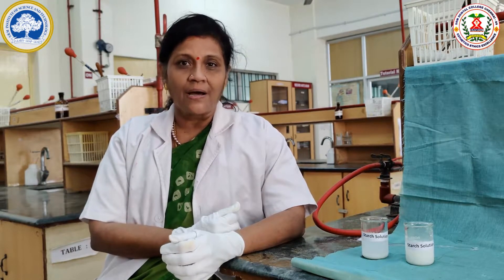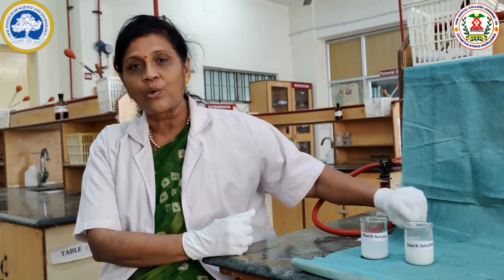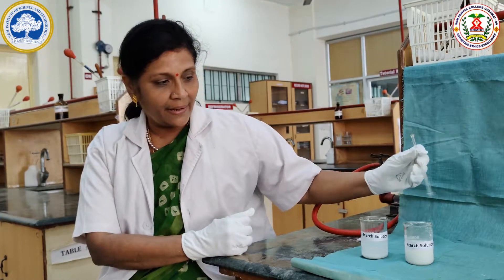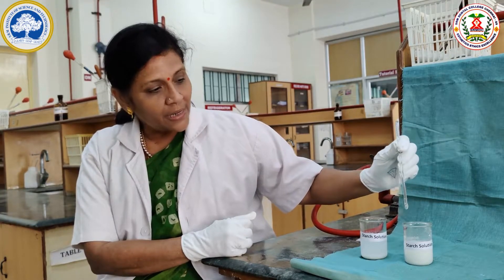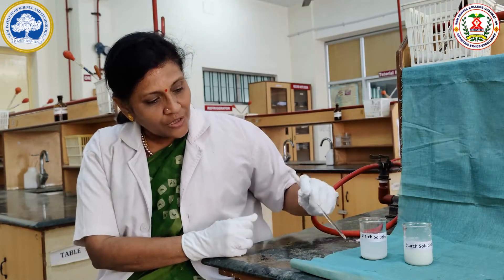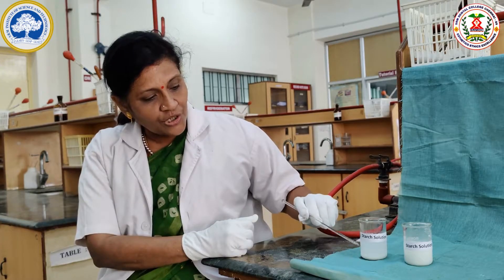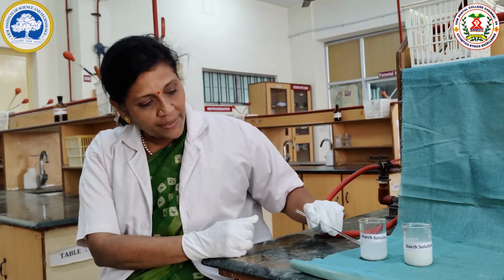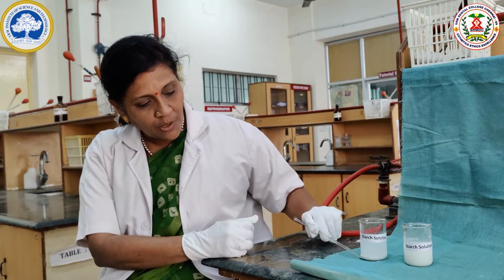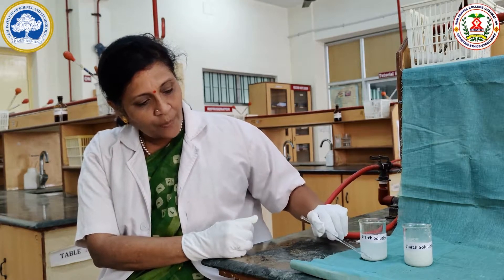As we all know, starch is a carbohydrate. We take carbohydrates mainly in the form of starch. Starch is formed of two components: amylose and amylopectin. This is starch solution. Starch is insoluble in water — we can see it is turbid. After settling for some time, the soluble component is amylose and the insoluble component is amylopectin.